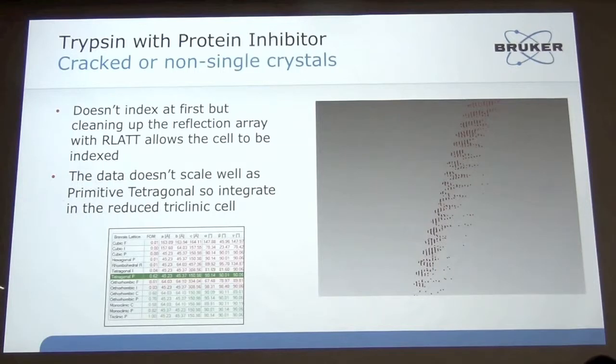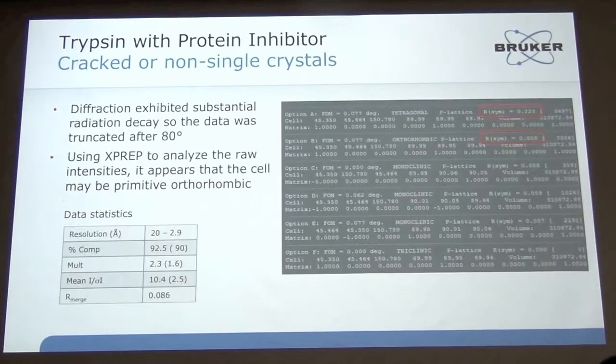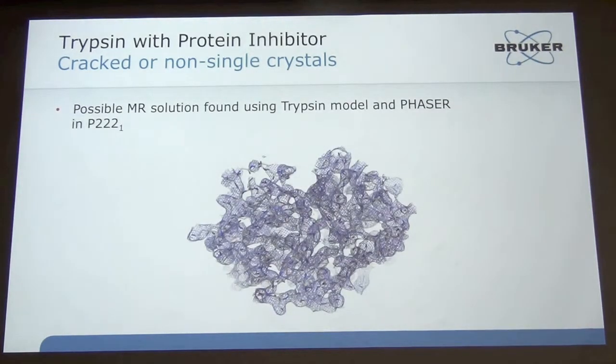and then you can easily start to separate all the noise that's in there. After that, it was easy to index it, and then it was just trying to figure out what was the correct space group. In this case, it was hard to tell which one, so I just integrated in P1, as Kai talked about. Looking at XPREP, you could see that orthorhombic shows good merging statistics, and then for tetragonal, the merging statistics go way up, so it looks like it's orthorhombic. And then using the trypsin model, I was able to get a solution in Phaser. So the space group probably is P2221.